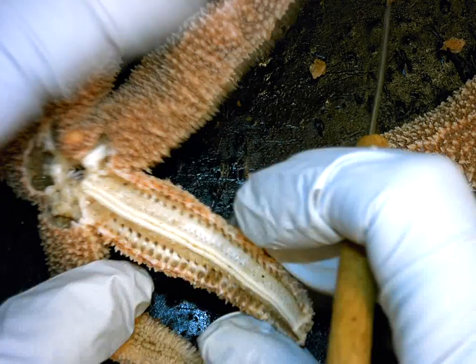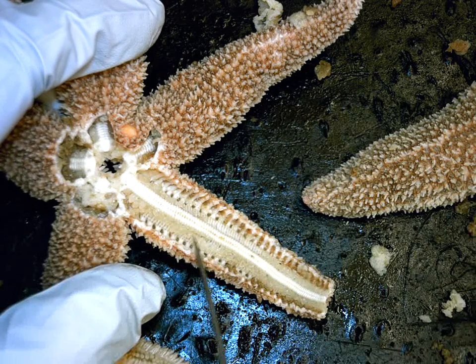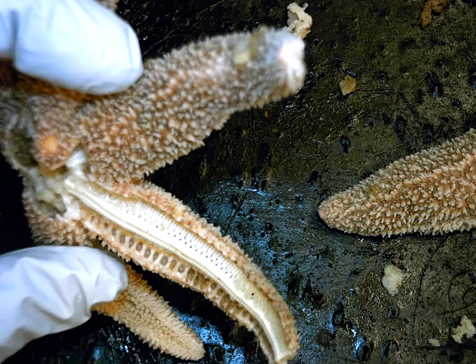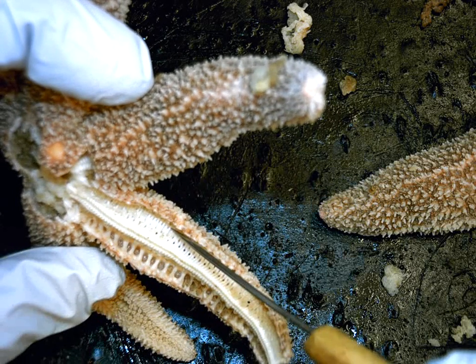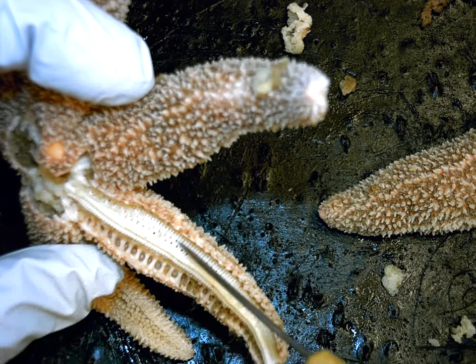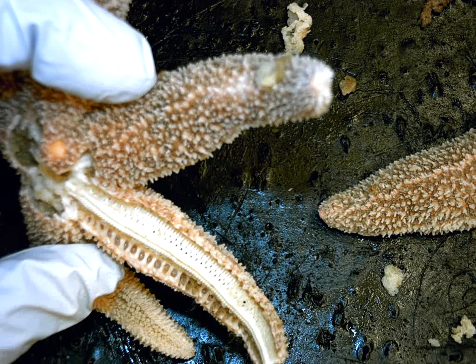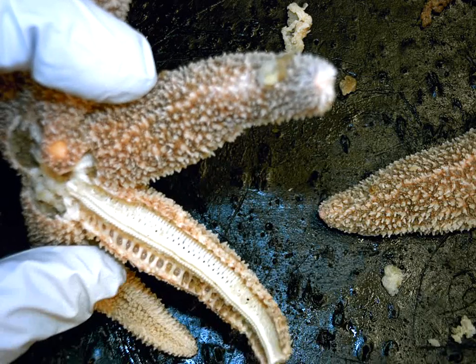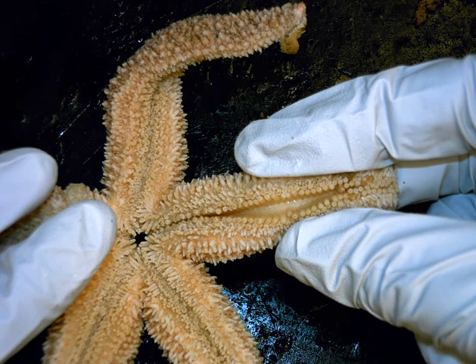Using a scalpel, I've scraped the ampullae off one side of the arm. On the untouched side you can see all those little fleshy ampulla bumps. On the scraped side, you can now see lines in the endoskeleton — the spaces between the lines are the lateral canals. There are repetitive pairs of openings going down in a pattern of two — representing the holes where each ampulla bulb sat and where the tube foot passed through the endoskeleton to connect the ampulla inside to the tube foot cylinder outside.